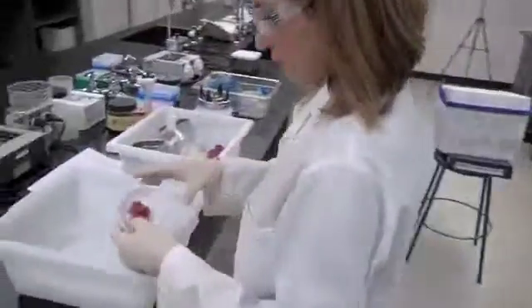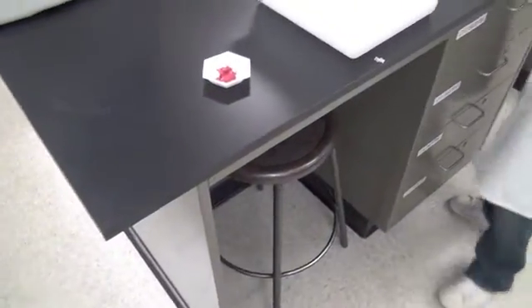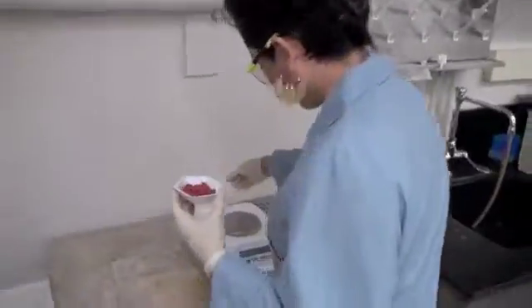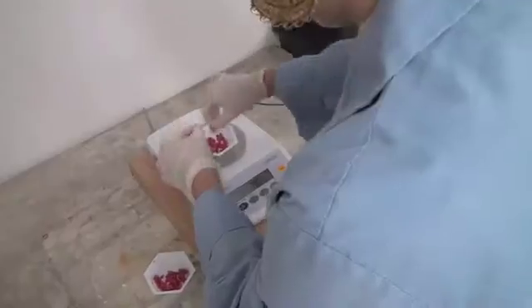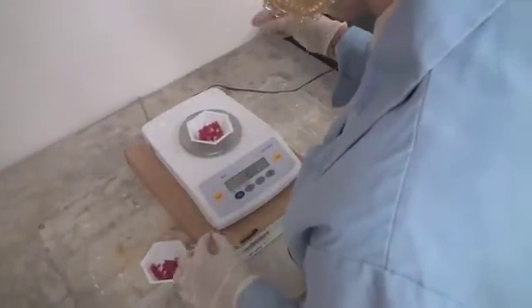Right, and getting back to the higher temperatures, this will lead to higher levels of degradation as there's more thermal energy to fuel processes like oxidation and proteolytic digestion than if the sample was kept over ice whenever possible. And it looks like Master TA is upset with Challenger Curate. Indeed it does. Master TA will likely be deducting protocol points from her total score. Biochemist Dicer, although taking a bit more time, carefully cut her beef over ice and will gain ground with a higher yield in the end.